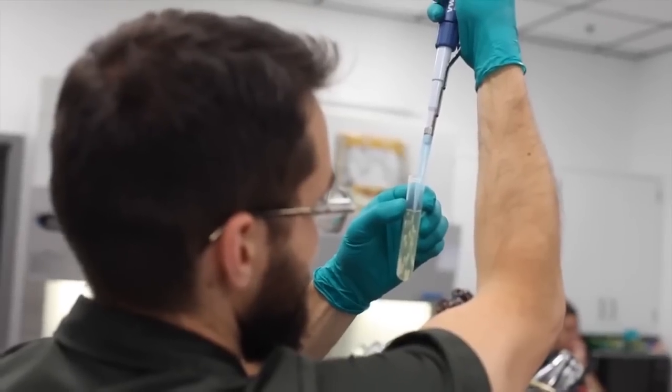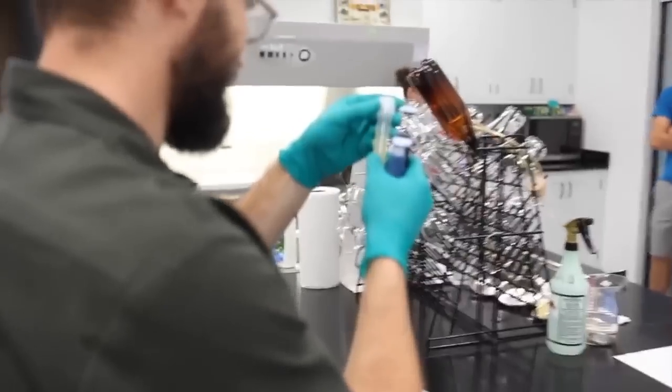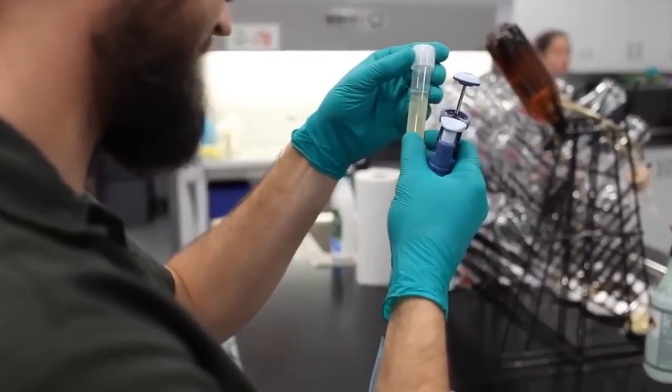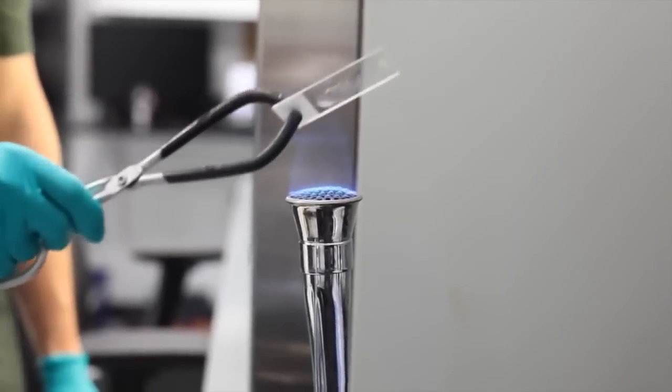Now, with this setup, we have a detection limit of 1 colony-forming unit per milliliter, so it's one of our less sensitive tests, but it'll catch bad problems, and it's an important media to have on hand if we want to verify colony identification from one of our more sensitive tests.